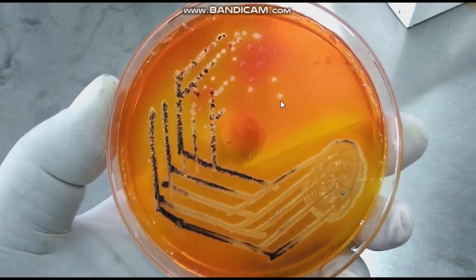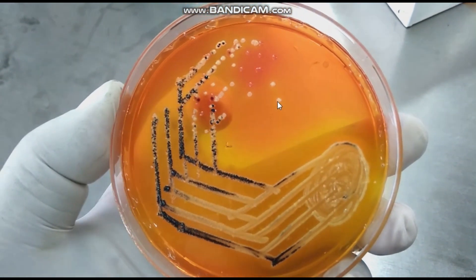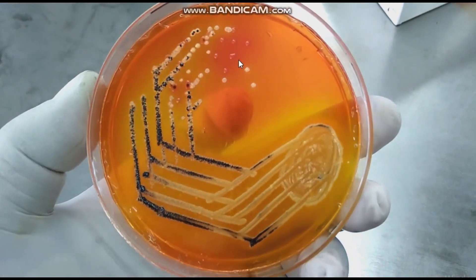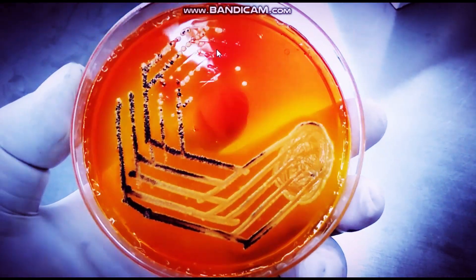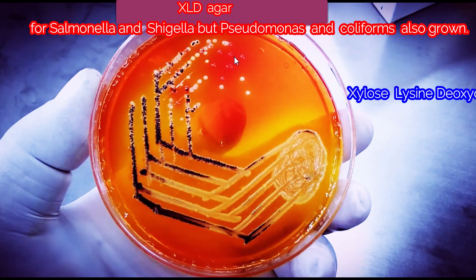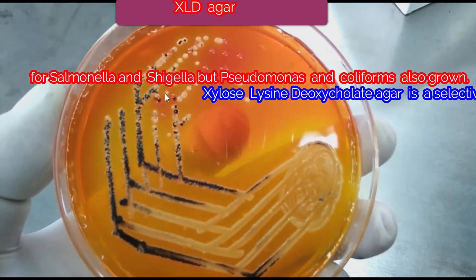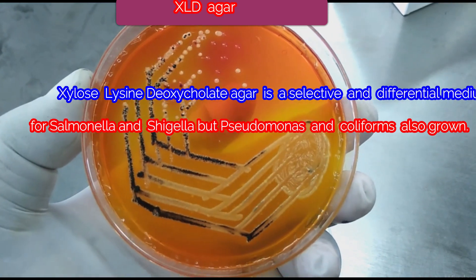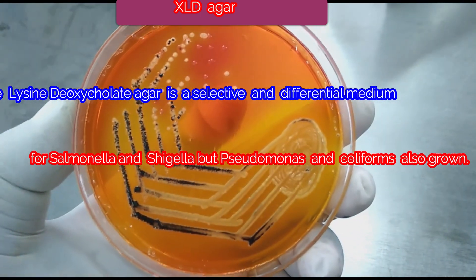Yellow colonies indicate coliforms. Shigella, Pseudomonas, or Salmonella paratyphi may give plain pink colonies. Salmonella other than paratyphi gives pink colonies with a black center.